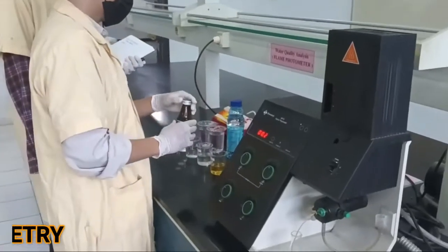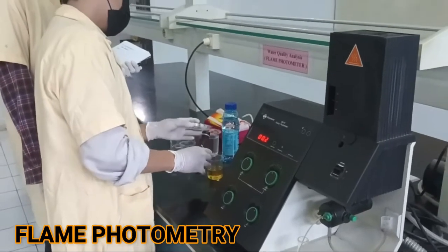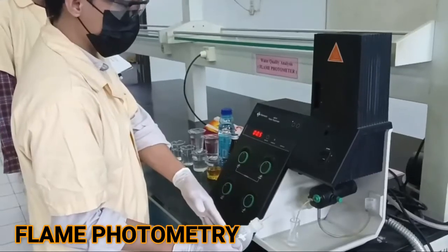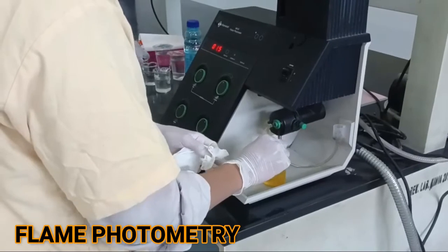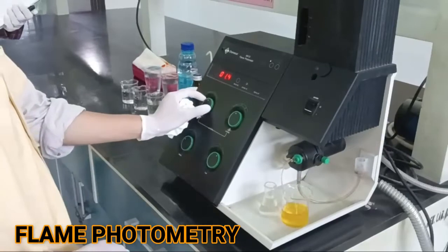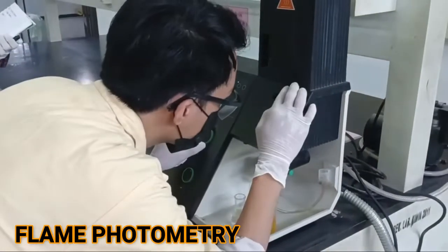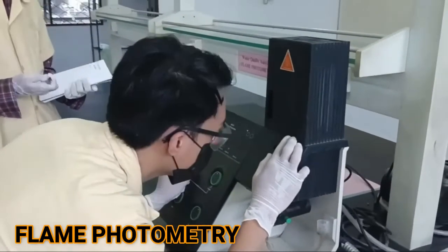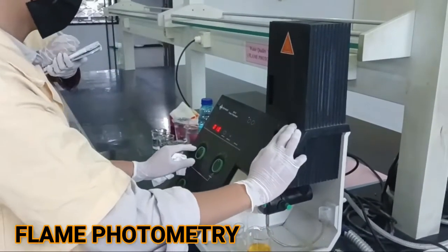In this experiment, students are expected to know techniques for analyzing the alkali and earth-alkali metals. In this experiment, the students are trained to use the flame photometer to determine the sodium and potassium concentration in commercial drinks and environmental samples. In addition, students are also expected to know the necessity of establishing calibration standard curves. These experiments support instrumental chemistry, analytical chemistry, inorganic chemistry, and environmental chemistry courses.